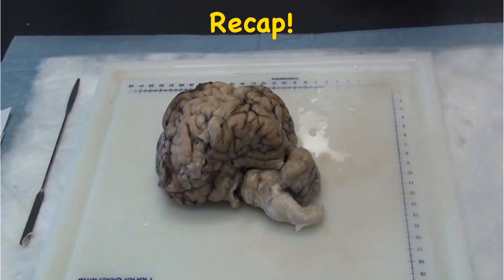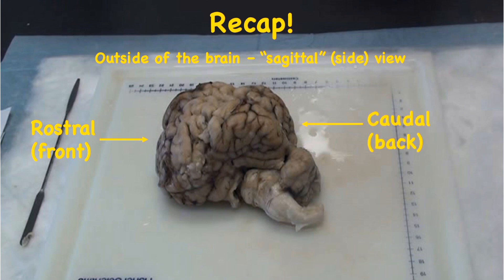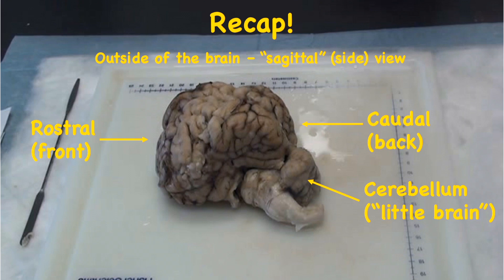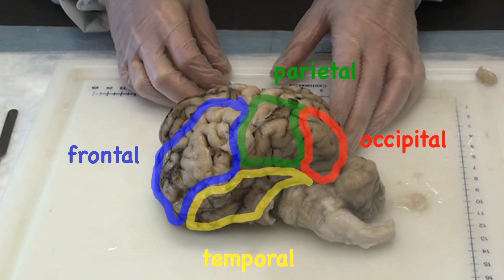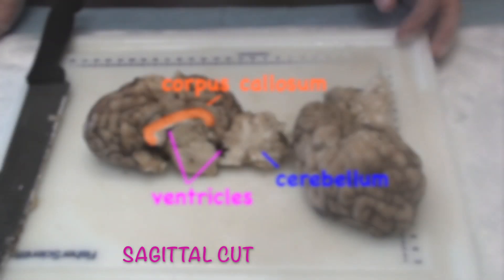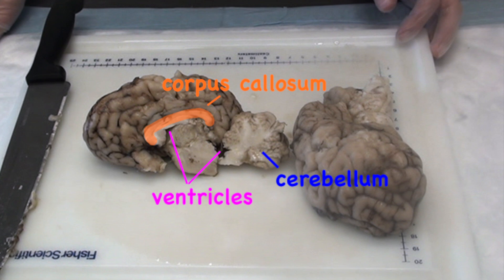Let's recap what we learned. This is the outside of the brain. The side view is called a sagittal view. We call the front of the brain the rostral part and the back the caudal part. At the caudal end, the cerebellum is below the cerebral hemispheres — this would be just at the back of your neck right where it meets your head. The brain stem connects the brain to the spinal cord and sends nerves down to your body. Here are the four lobes of the brain: the frontal lobe is at the front, the parietal lobe is on top, the occipital lobe at the back, and the temporal lobes along the sides. When we cut the brain in half sagittally, you can see the corpus callosum which connects the two cerebral hemispheres so the left and right parts of your brain can talk to each other. You can also see two of the ventricles — empty spaces that are usually filled with cerebrospinal fluid — and the cerebellum at the back.